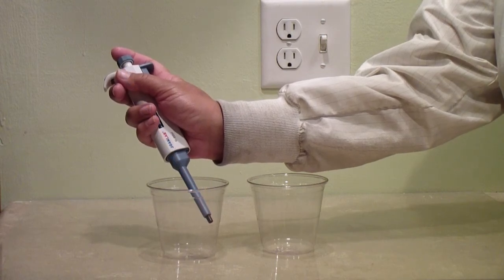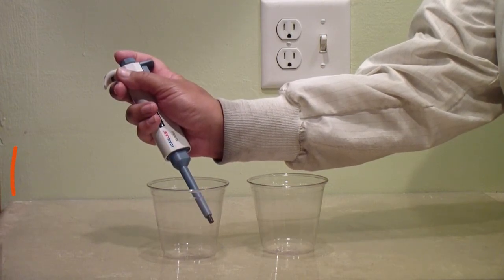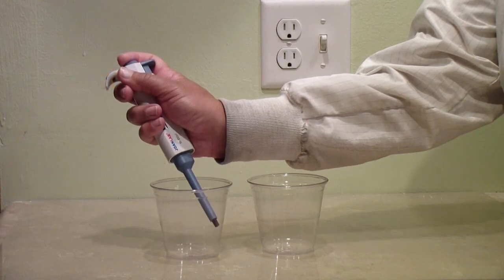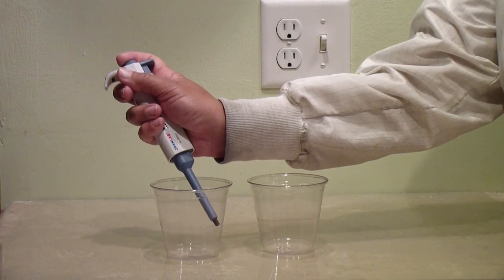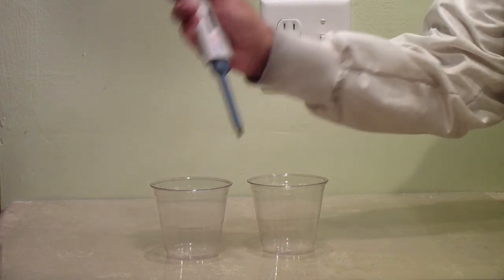Now press the plunger down to the first stop and all the way to the second stop. This will deposit the imaginary liquid into the imaginary container.